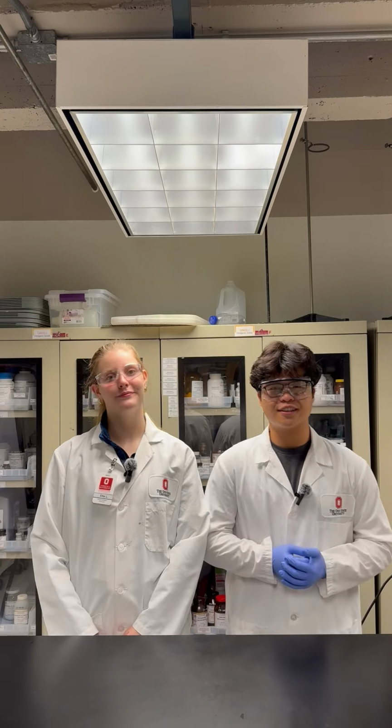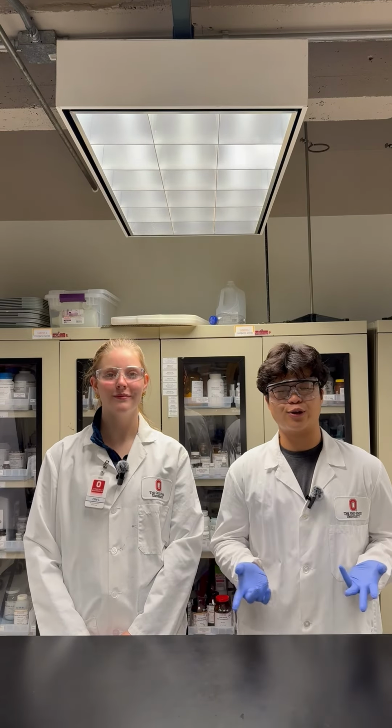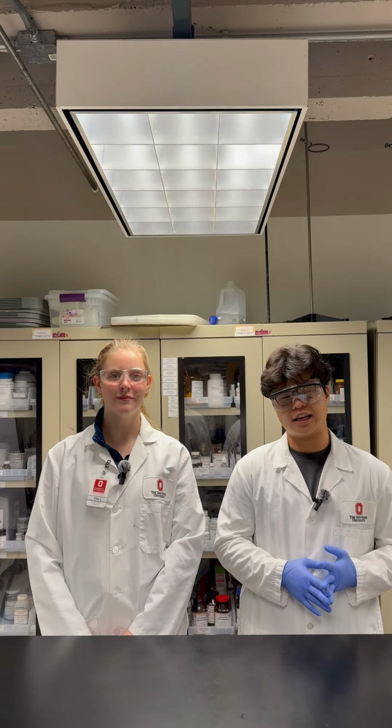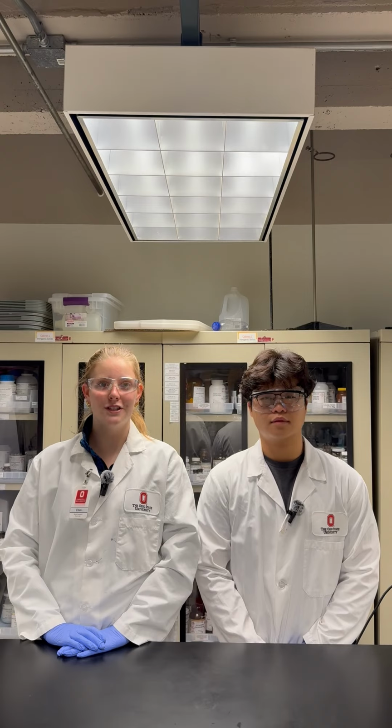Today we're going to discuss endothermic and exothermic reactions by showing our thionine reaction, which is an endothermic reaction. Before we get into that, let's do a quick review of redox reactions.